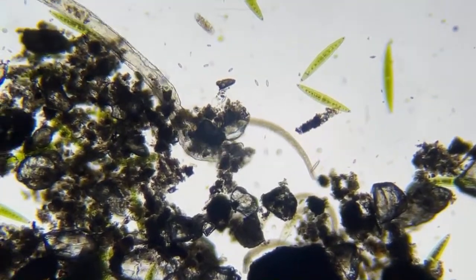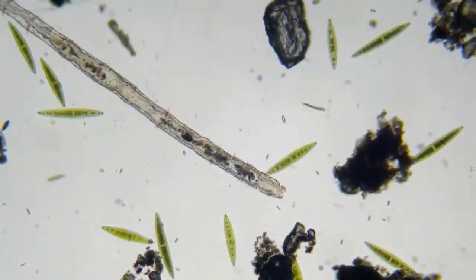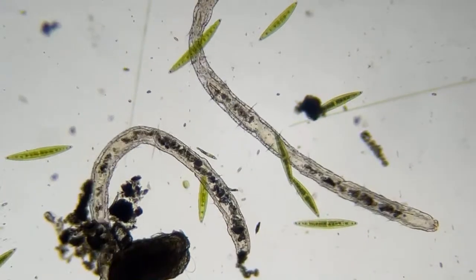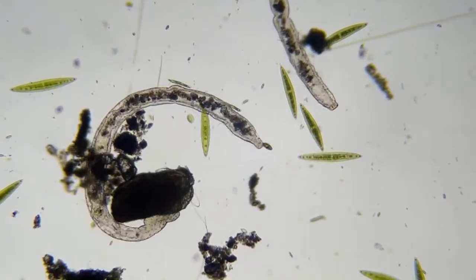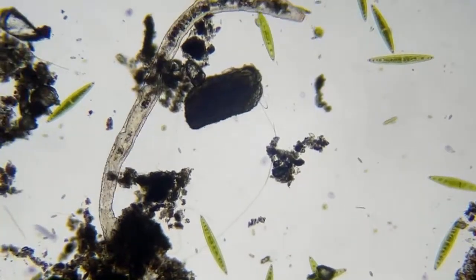Oh, you're talking about how I zoom in and out or move like this? I'm mixed up. So moving like this is called a 3D stage. So are you talking about how I zoom in and out?